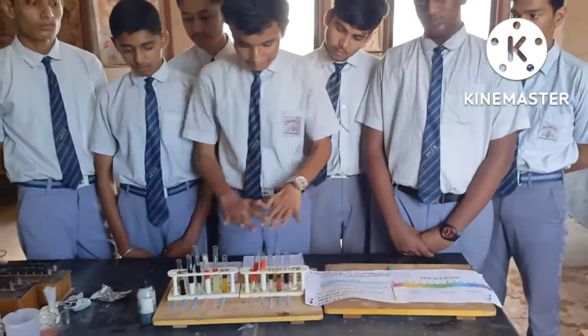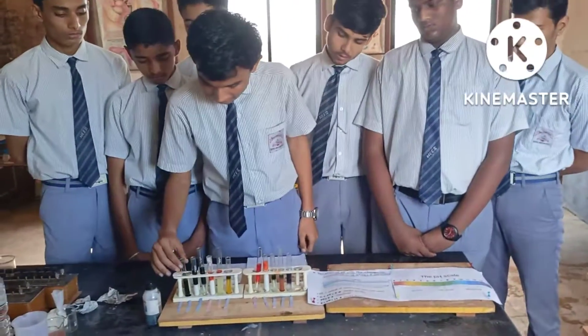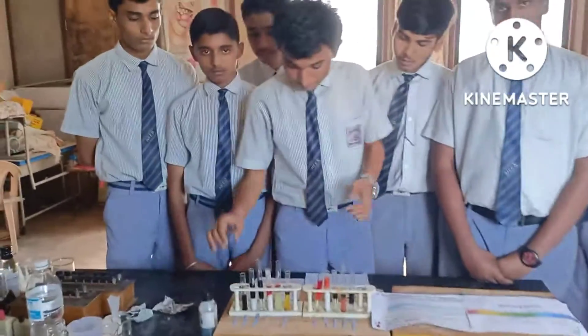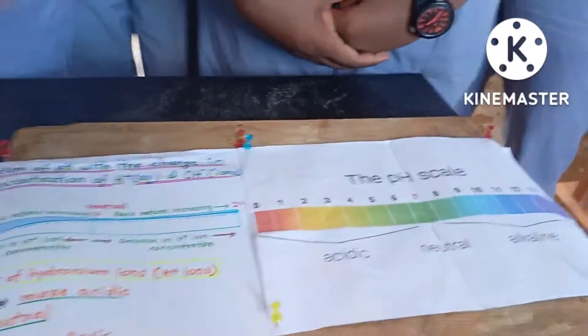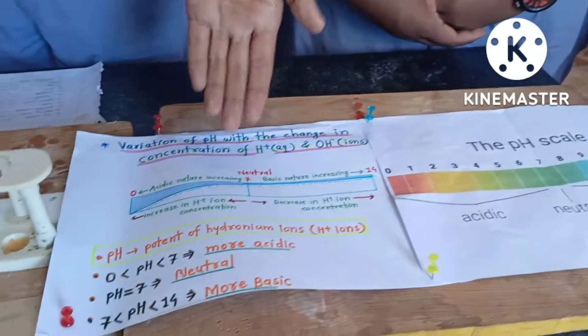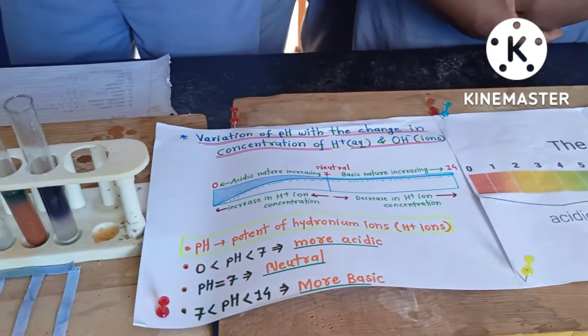When we put the indicator in this, here we can see its color has changed. And based on this color, we could know the pH of this substance and hence we will know the acidity and basicity of the substance.